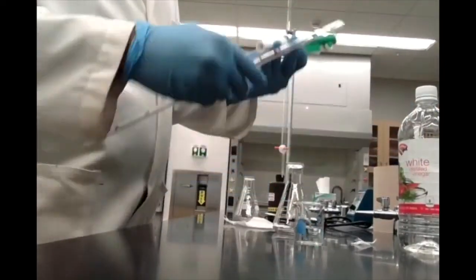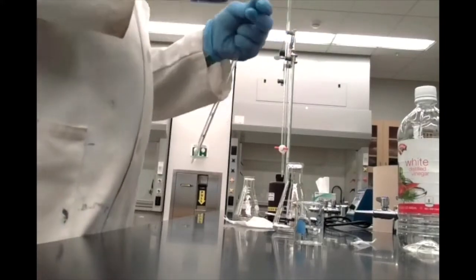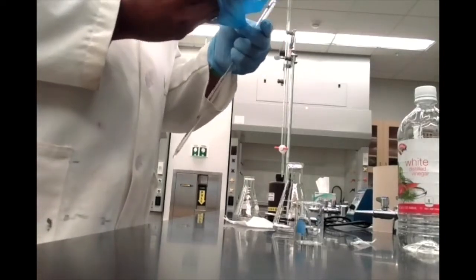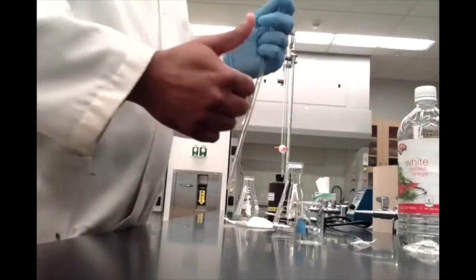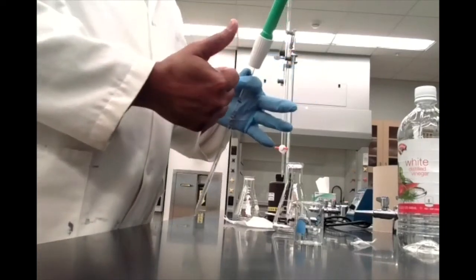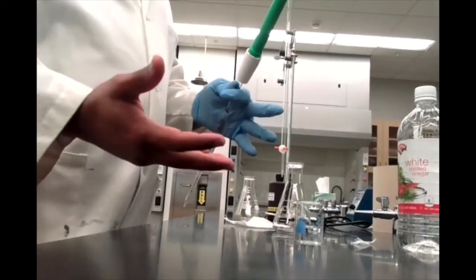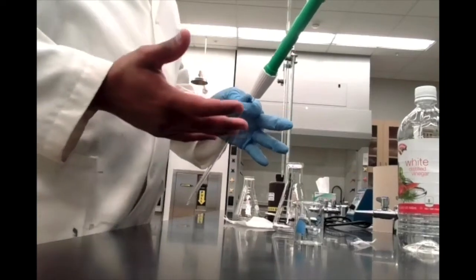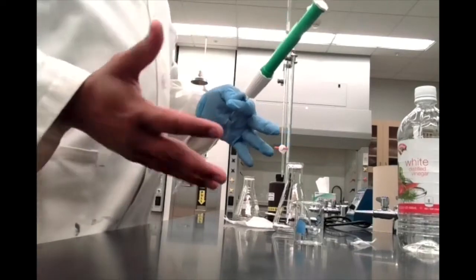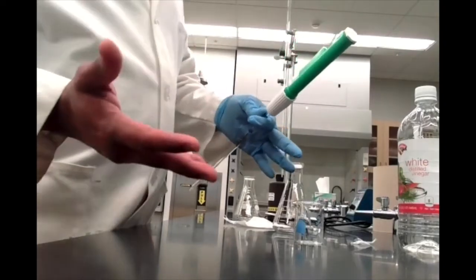So taking our clean, dry pipette, we'll go ahead and add our pipette bulb to that. I'm going to actually take off one of my gloves. If you remember from my earlier video on this, it's hard to adjust the volume with a gloved hand. I find it easier to form a seal on my pipette using my bare thumb. Again, generally you want to wear gloves in lab, but in this case we're not dealing with anything too harsh, or even our sodium hydroxide for that matter isn't super high concentration. So if I get anything on my hands, I can probably wash it off without damaging my hands.